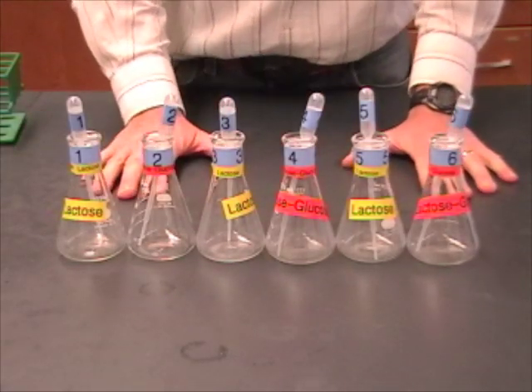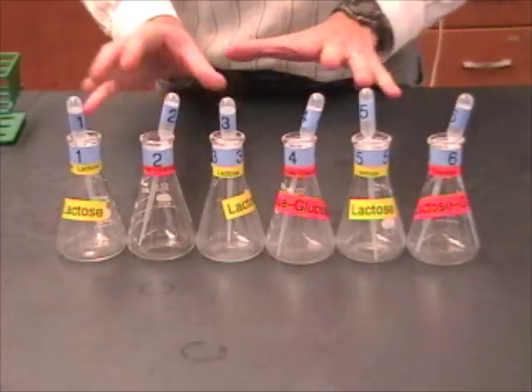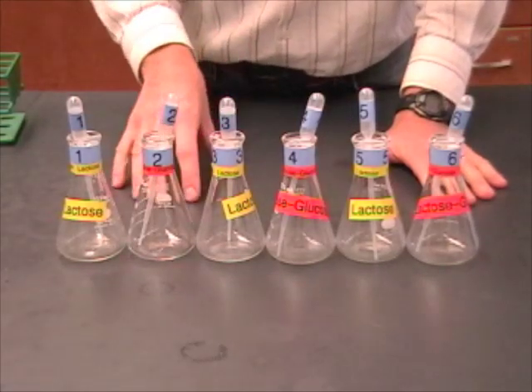There's a lot of preparation to do before you get started. Now every table is going to have six of these flasks and every student is going to get one flask.